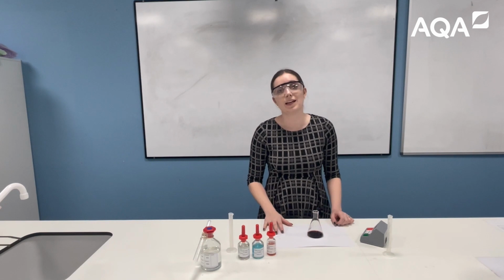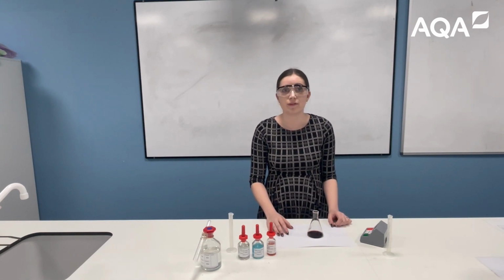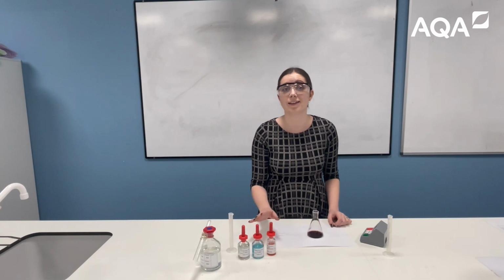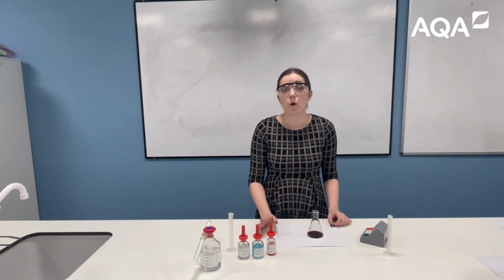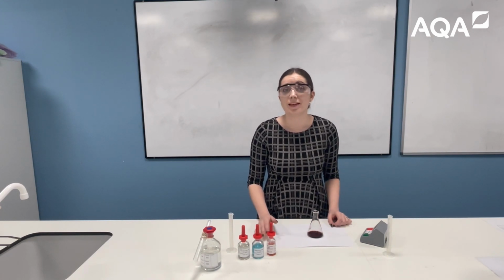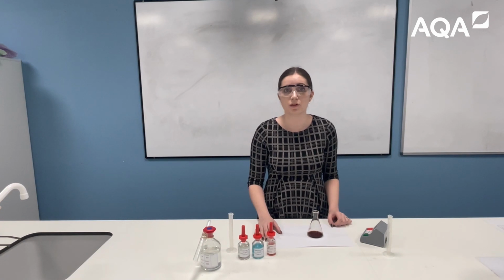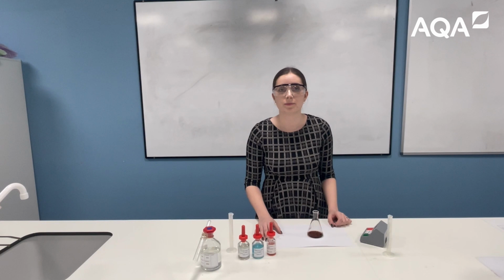Now this has a very direct link to rates of reaction and investigating the effect of catalysts on a rate of reaction, as students can use copper, cobalt and iron ions to catalyse this reaction. So they can record the time taken for the cross to appear in each case and evaluate the effectiveness of each catalyst. This of course has a link to activation energy and to chemical changes and the effect of a catalyst on the rate of a reaction.